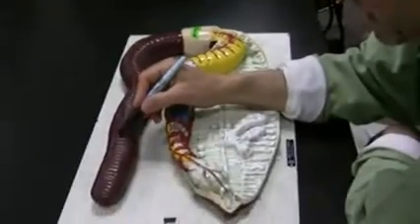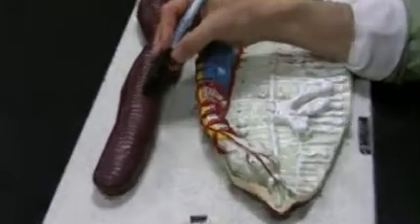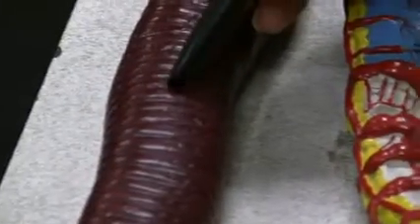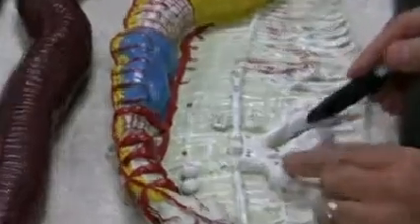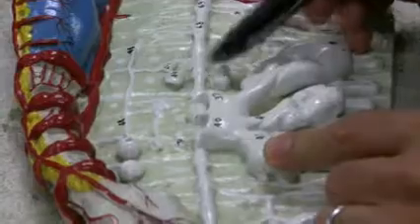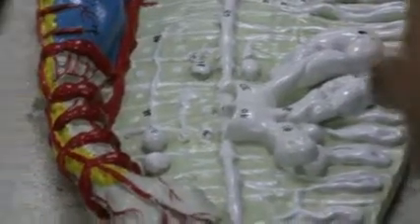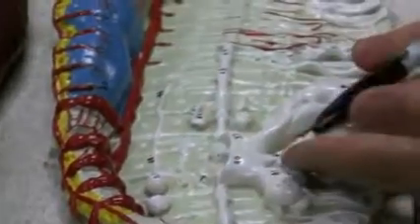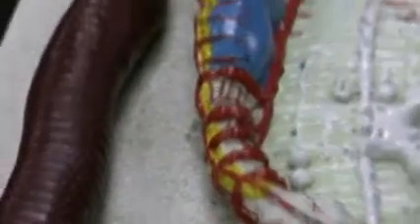So each one of these is a metamere or segment, and the ring is metamere, the groove between the 2 rings is annuli. Is that right? Okay, so the big ones right here, these huge big ones, are seminal vesicles. The small ones, seminal receptacles. Okay, so seminal vesicles have to be bigger to make sperm and store sperm, right? Today's lecture question. And seminal receptacles, all they have to do is store sperm after copulation, right?